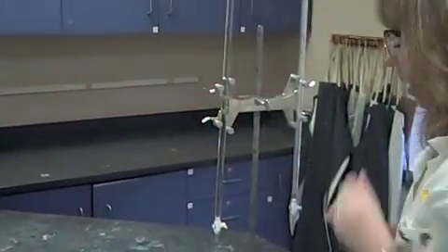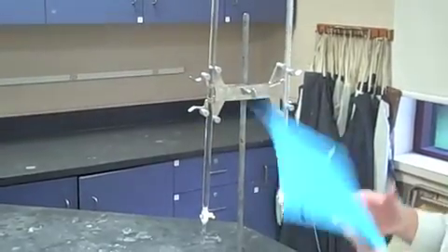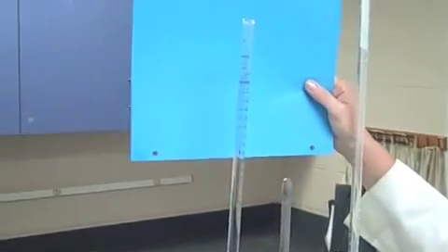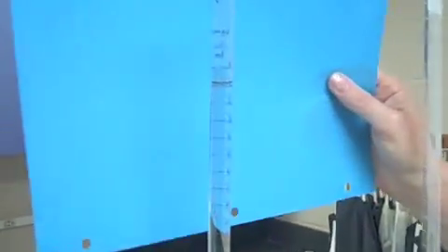Now I'm going to put the burett here, and I want to point out to you - you'll zoom in on this - you can see that we now have a pretty nice background showing how much is in the burett, the beginning volume.